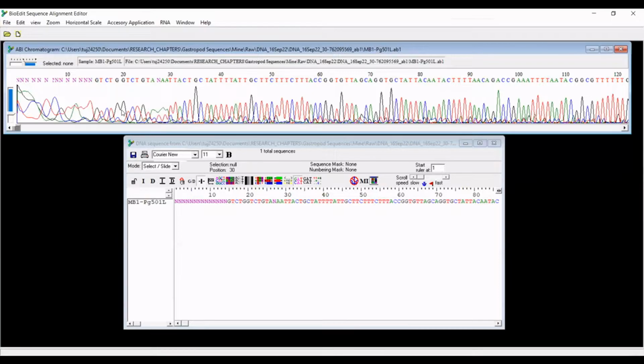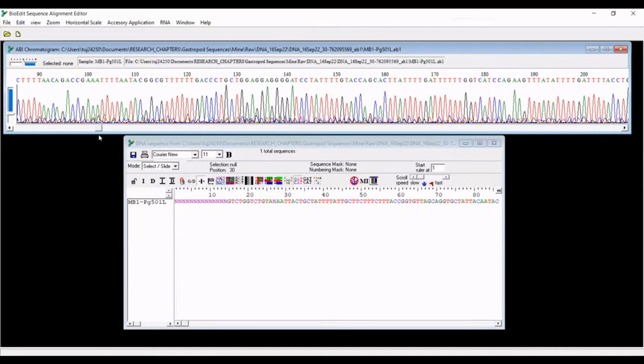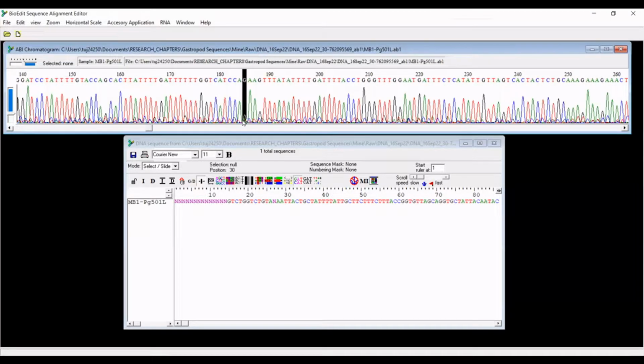And so this is a really good way to visually assess the reliability of your data. So you can scroll through this, and each of the peaks represents a base call. And so you can see the resultant read at the top here. They're color-coded, so it makes it very easy to read. And you can also see if there are areas such as this position here, where there's some unreliability. Perhaps this base call is not super confident.